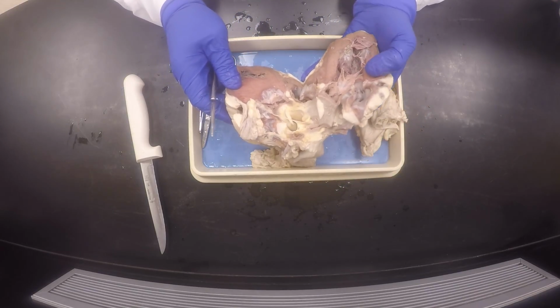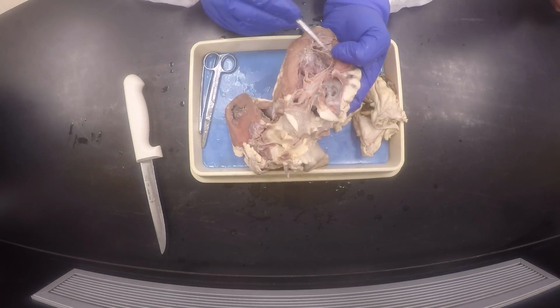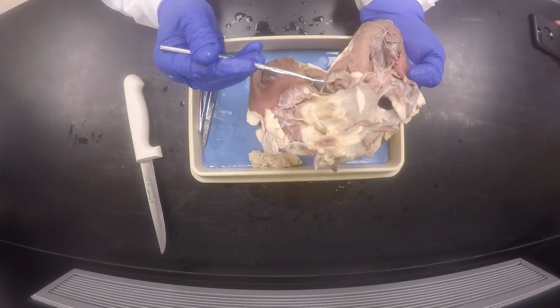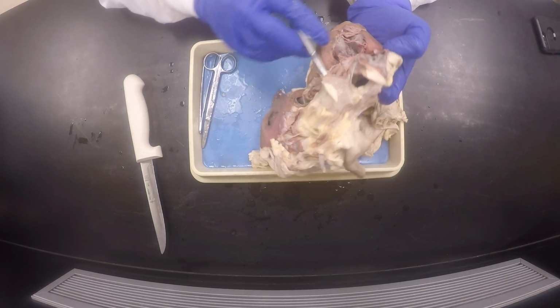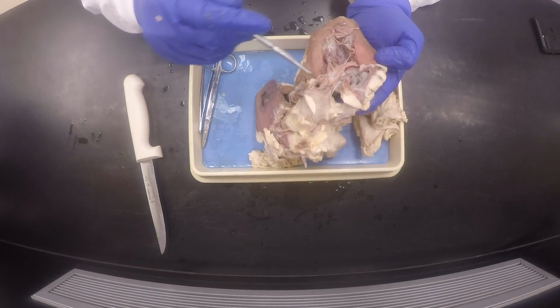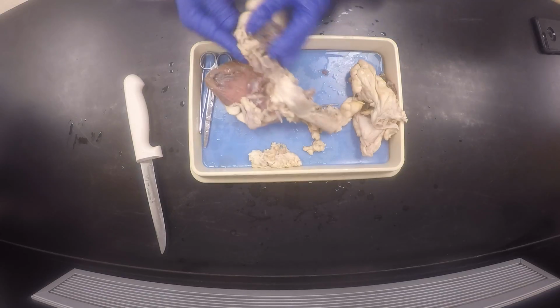It's almost time to go. And this is the chordae tendineae attached to the papillary muscles on the ventricular myocardium. This is the tricuspid valve on the right side. And then of course there's the aorta coming out there. The semilunar valves would be located here. This is part of the semilunar valve right there.